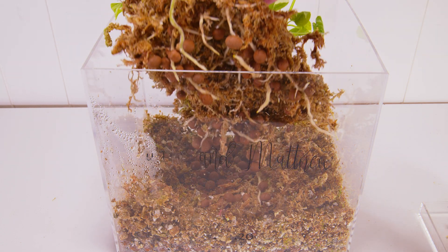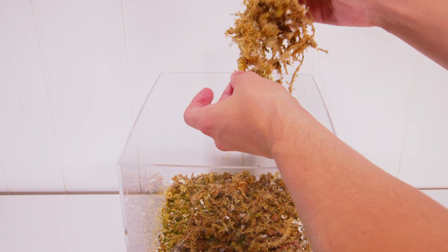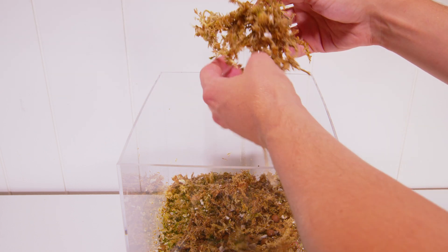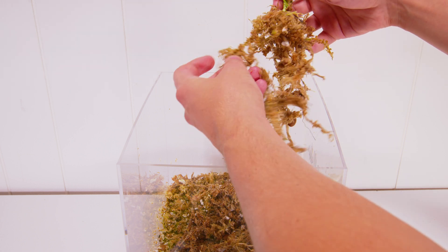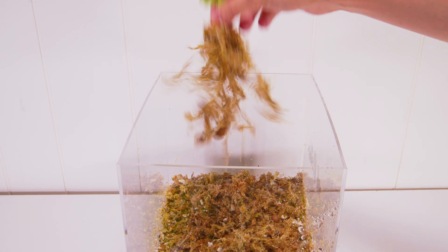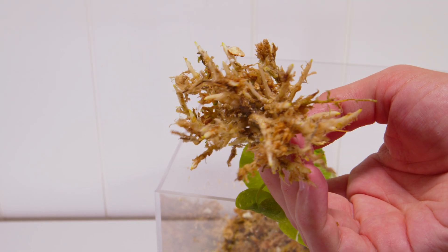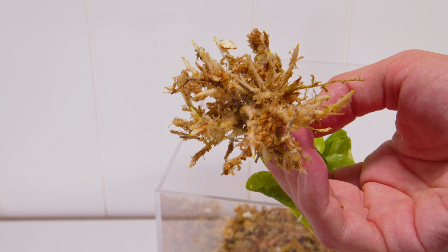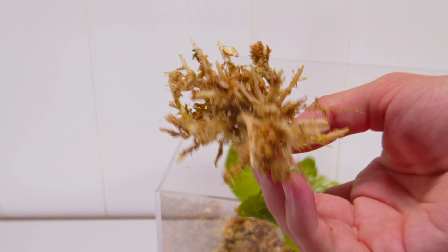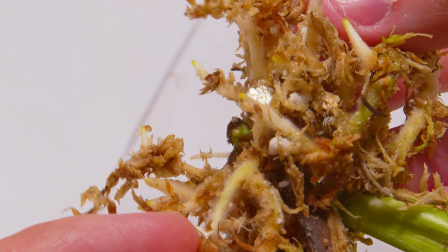Towards the last 10 days of this month-plus period, I did open up a little crack on the top and slowly start to bring that humidity down a little bit, just so when I pot them up it isn't a super shock to them. I'm really taking my time with these — that is one of the other huge keys for success. Do not rush this process. If you're going to invest in buying a bunch of these plants, these awesome Thai Constellations, don't rush it. You're going to keep this plant for years, so there's no reason to rush the deflasking process.